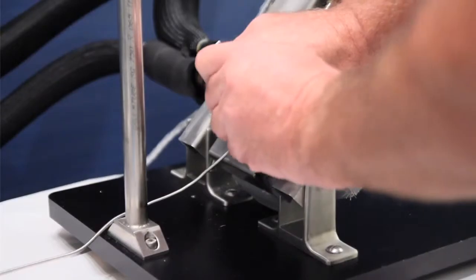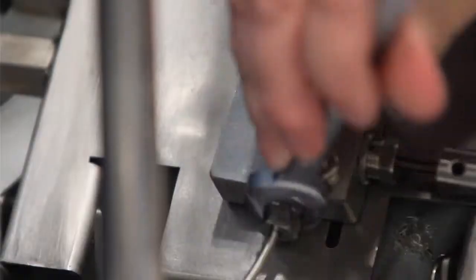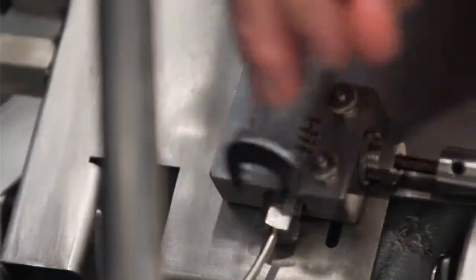Next, we need to disconnect the sample inlet tube from the PVT system by unscrewing the nut with the supplied wrenches turning counter-clockwise.